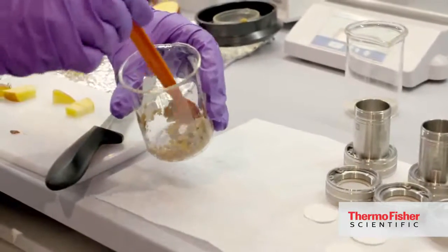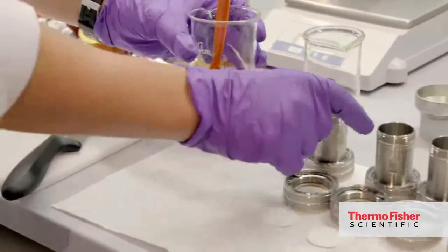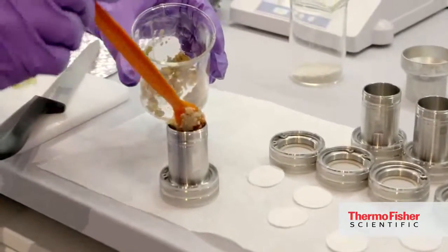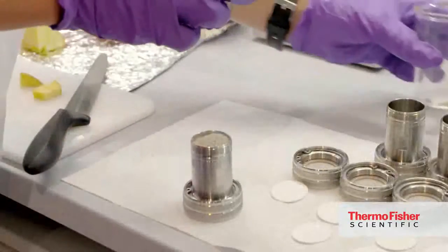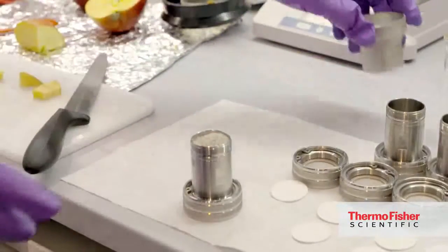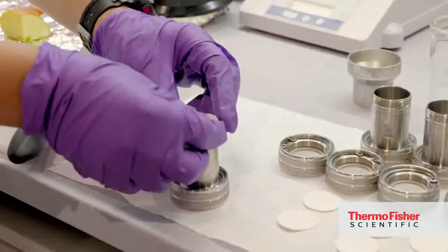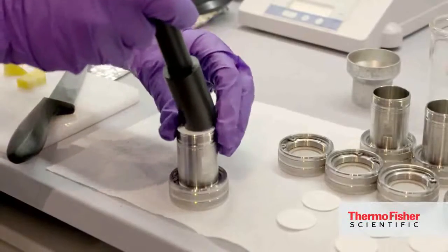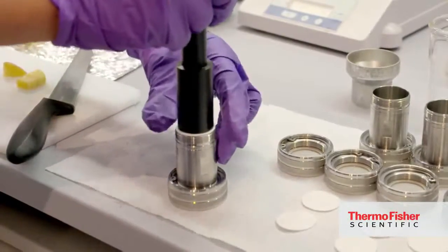And when it is ready, then it is simply put into the cells, the extraction cells. When it is ready, we just cover it with a filter. Just push it on the top.